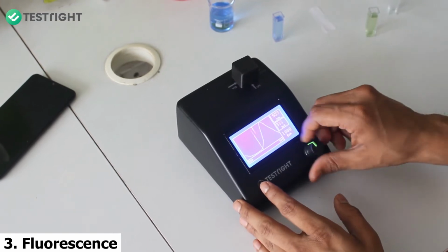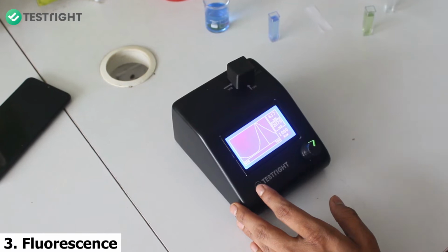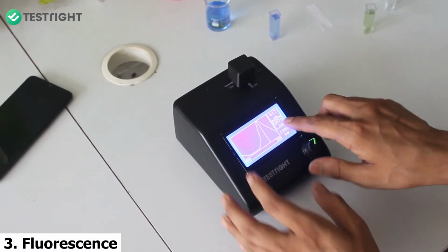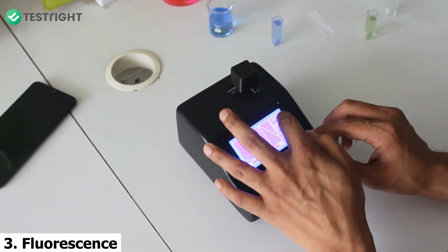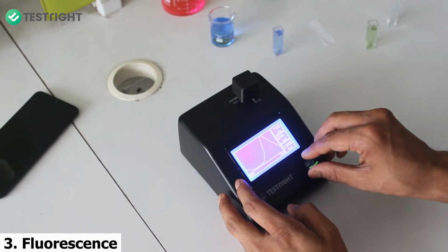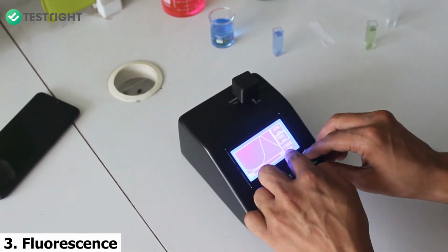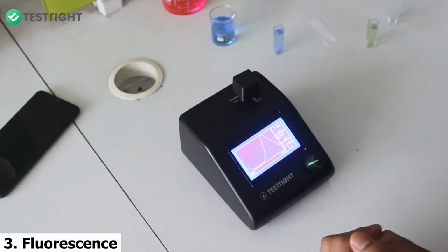So you can move it to the peak and see the counts at the peak, which is 2870 in this case. 2870 counts at 617 nanometer wavelength. I can move this forward so that the cursor comes on to this exposure. This is 1000, which is the exposure time in milliseconds.